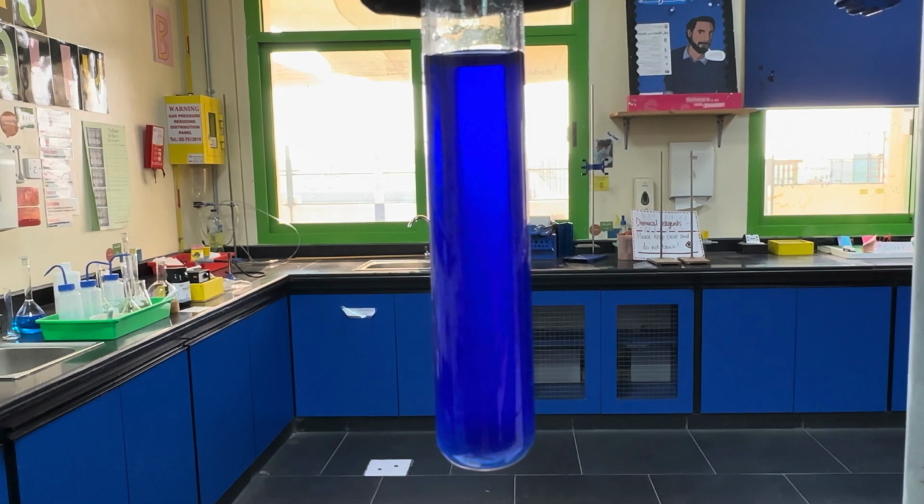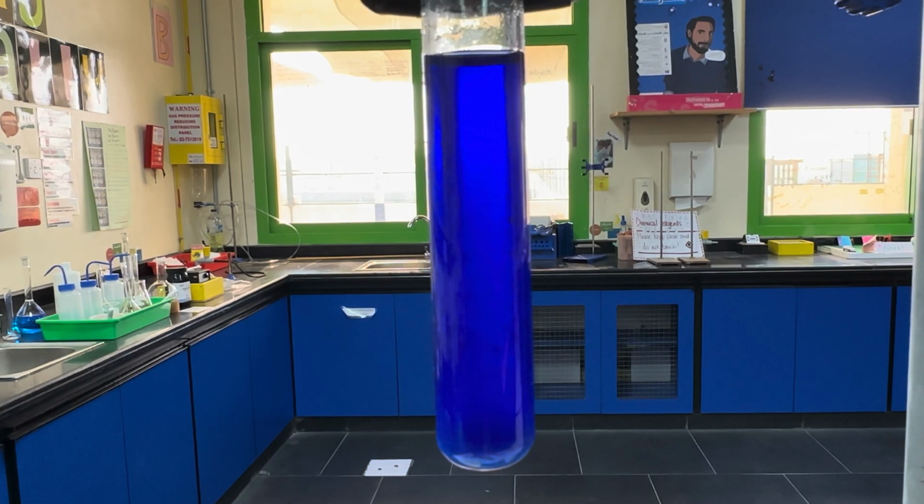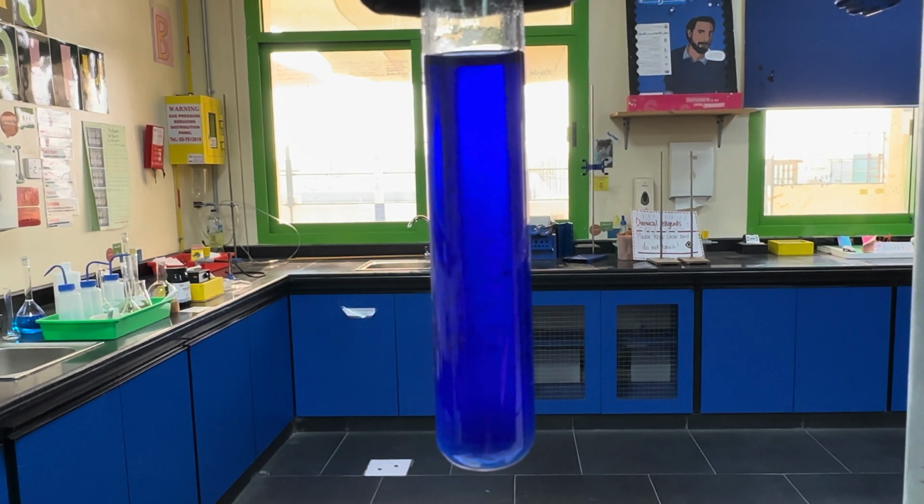So let's just summarize what we've just seen. In the first reaction, we have 2 water ligands that are replaced by 2 hydroxide ligands in the reaction. And then when we added ammonia solution, the pale blue precipitate dissolved and we got a deeper blue solution because we substituted the 2 hydroxide ions as well as 2 of the water molecules for 4 ammonia molecules. That formed a deep blue solution because our complex regained its charge.